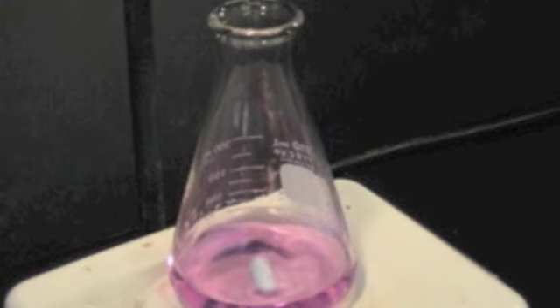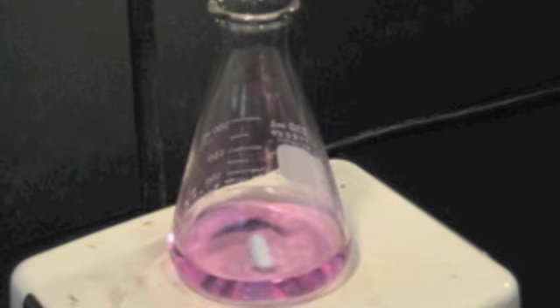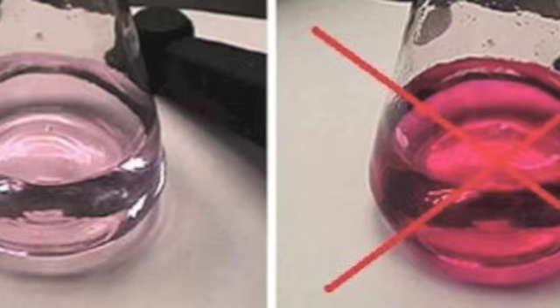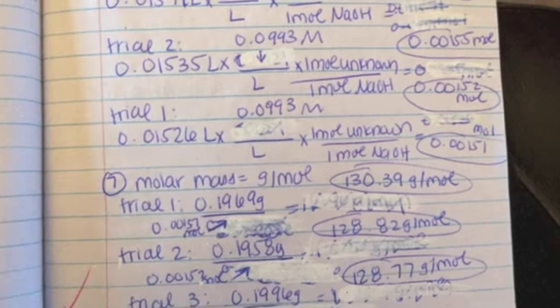The opposite of this error is over-titrating the solution. This is when the solution turns a bright pink color and has passed the equivalence point. More NaOH will be used, causing the calculated molarity of the standardized NaOH to be less than it is. The moles of unknown acid present would be less than it should be, and the calculated molar mass of the unknown acid to be greater than it is.